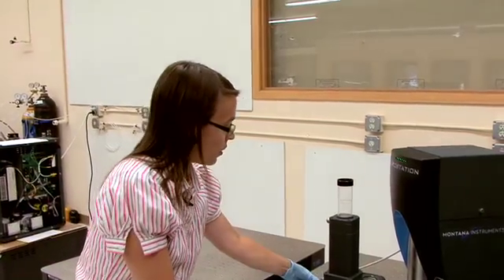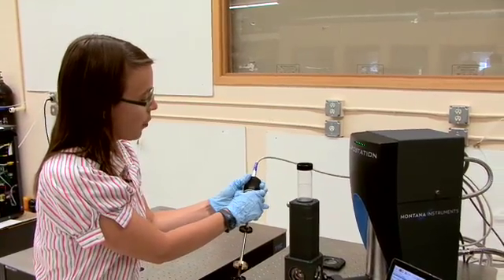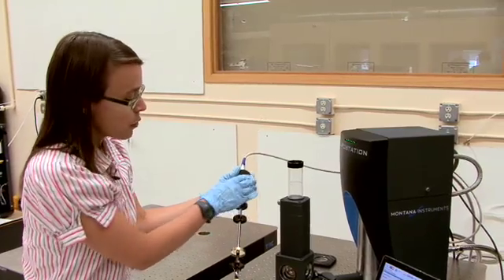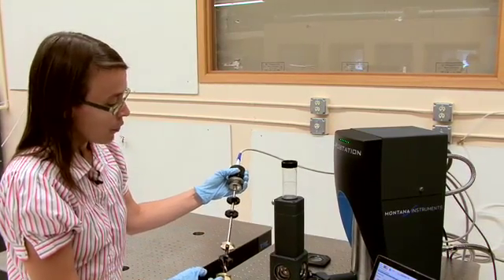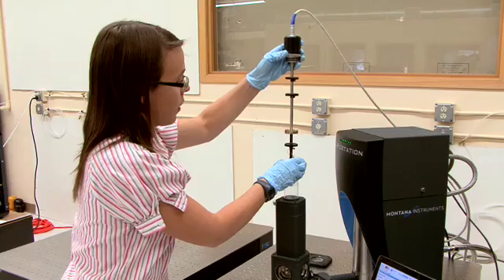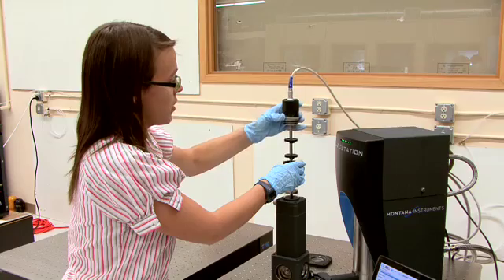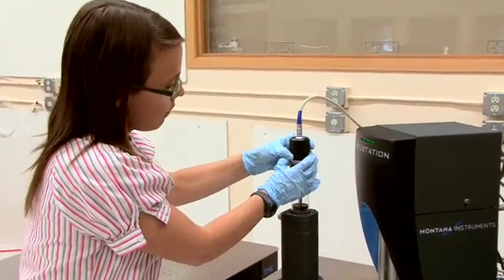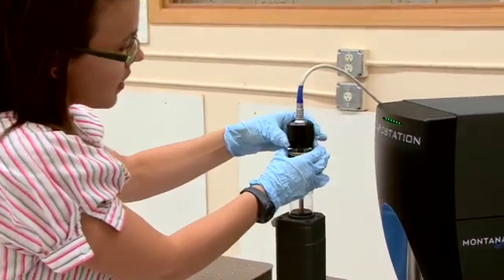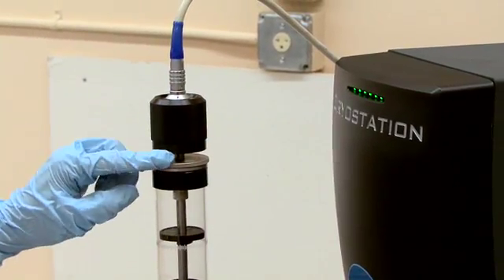Once you've mounted your new sample you can insert the sample rod back into the chamber. To do this first loosen the knurled nut and create a gap between the top of the sample rod and the knurled nut. This will prevent the bottom of the sample from going into the sample chamber before it's at thermal equilibrium. Gently lower the rod back into the sample housing. Tighten the knurled nut and maintain that gap.